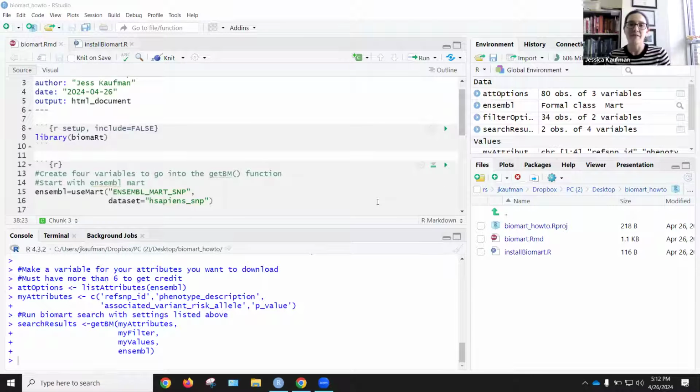In this video, I'm going to walk through some of the troubleshooting that you can do when you're doing a biomart search using phenotypes. One of the things that I think will help is explaining a little bit about the structure of the function getBM.